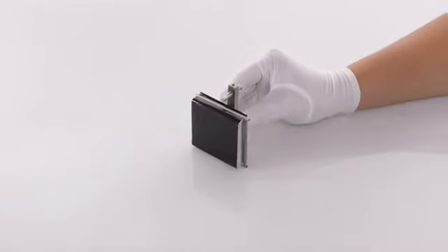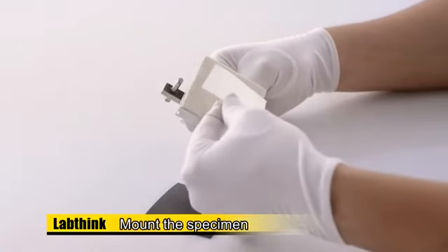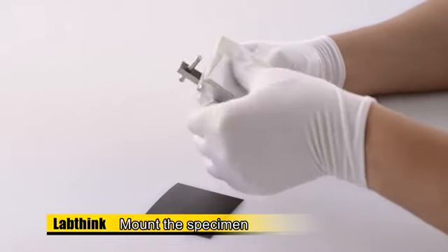If the specimen is a rigid material, fix the 63.5 mm by 63.5 mm specimen on the back of the sled directly with double-faced adhesive tape.